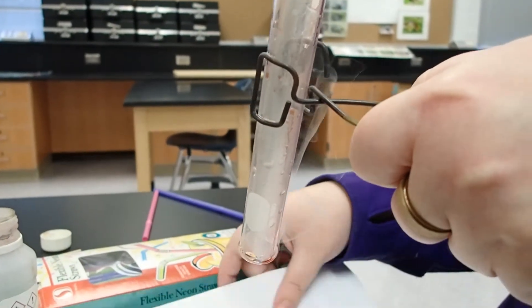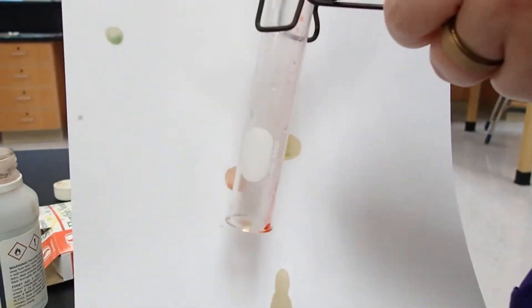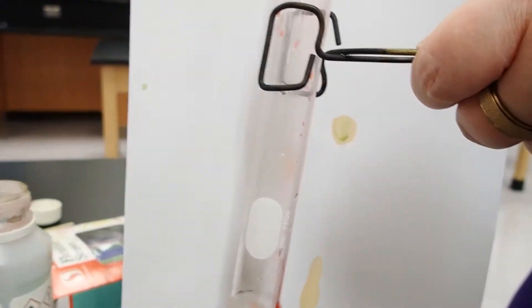But now when I hold up my paper, oh, you can see that red spot right there. We used that same indicator, but now it is red in color.